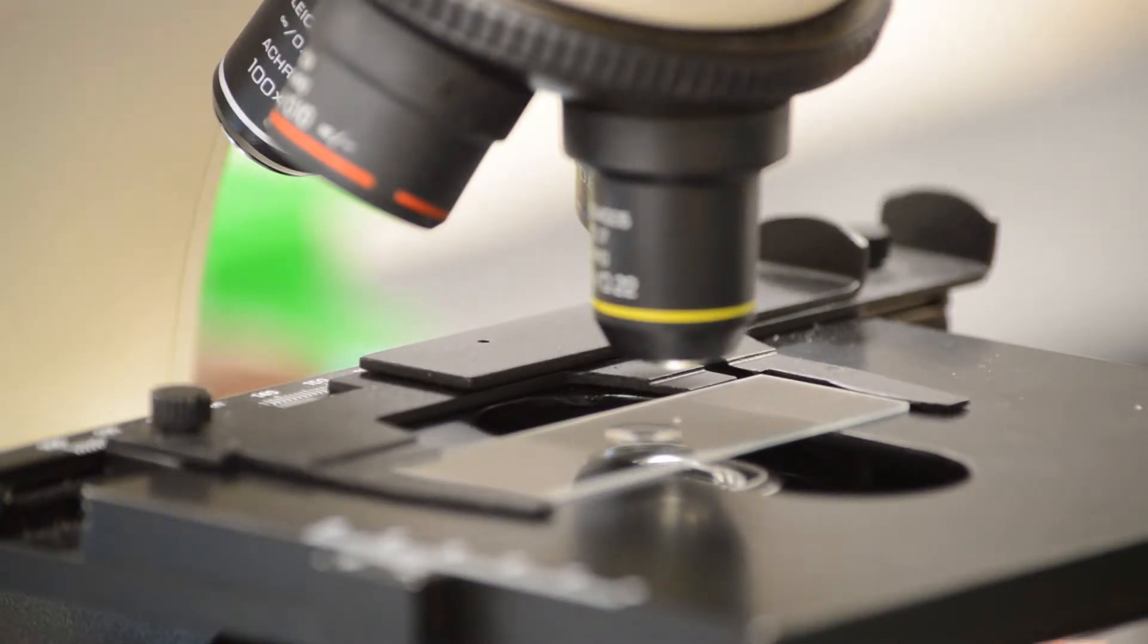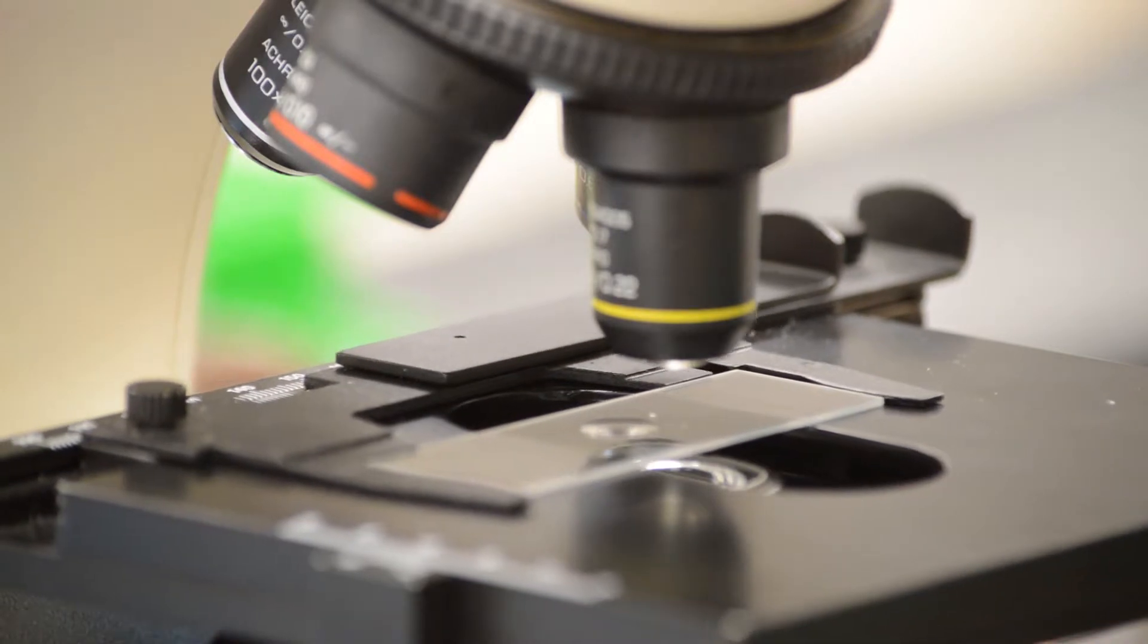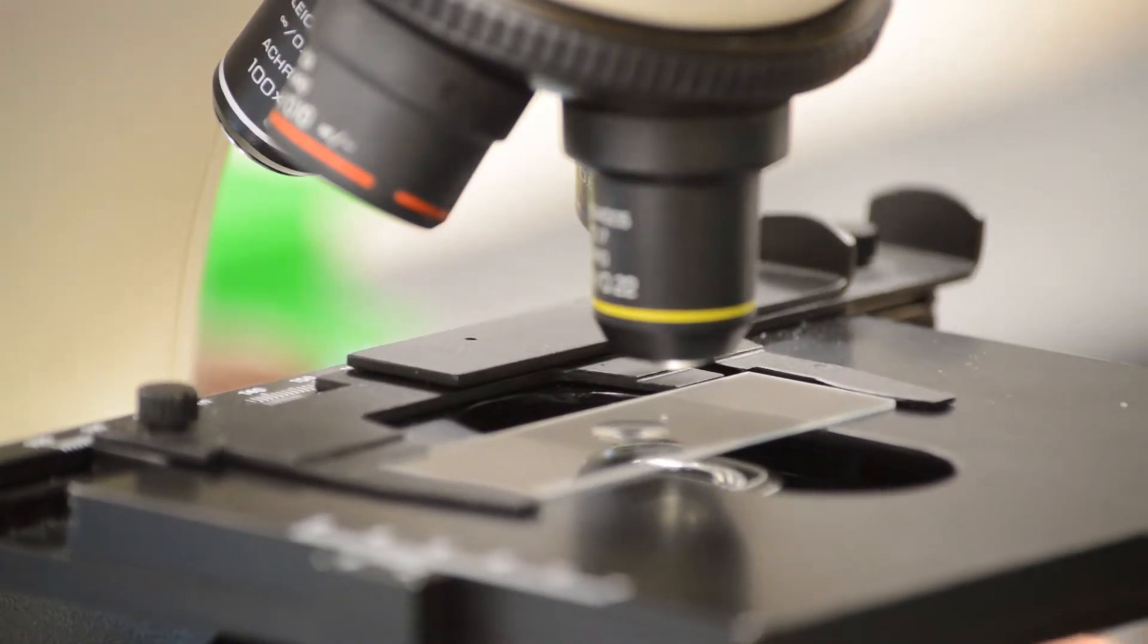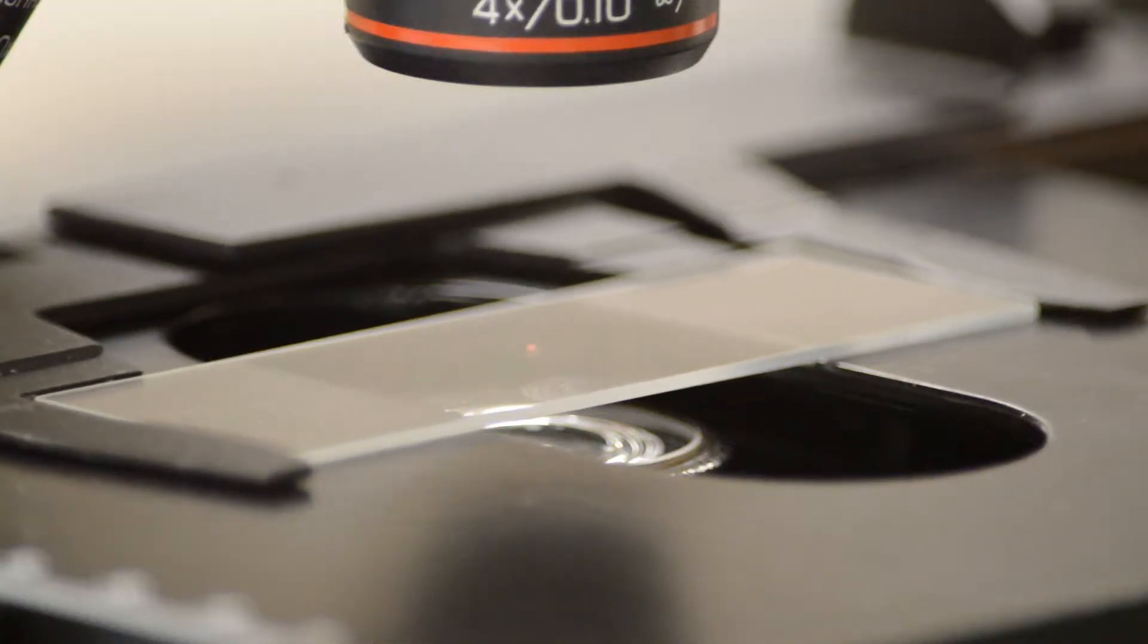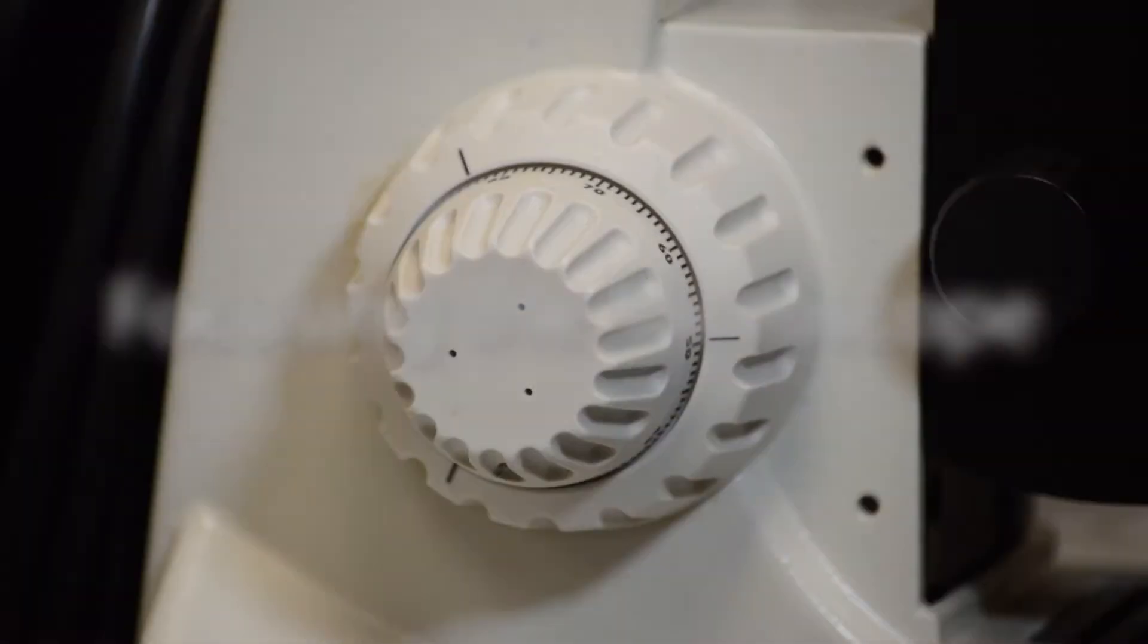You use these knobs to center your material so that you can observe it, because if you try and move the stage with your hand what will happen is you will not be able to get the fine control that you can get out of these particular knobs.